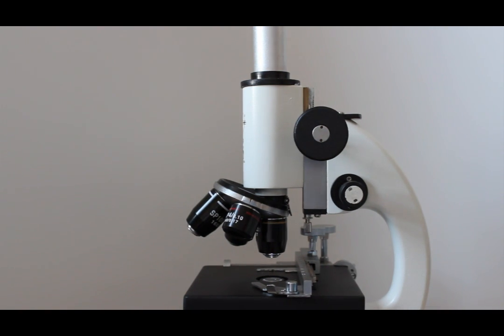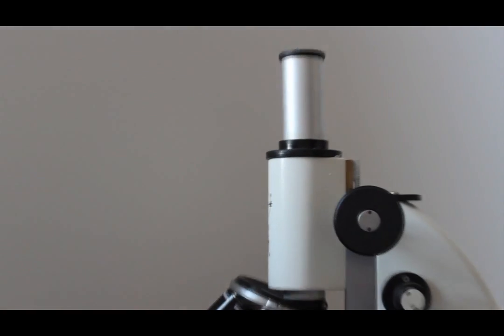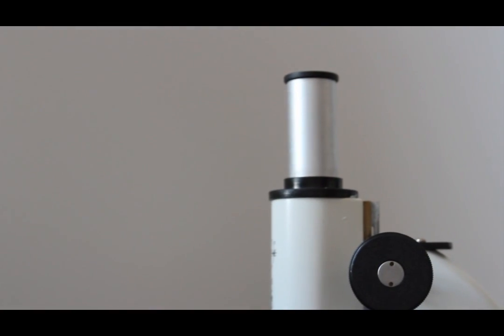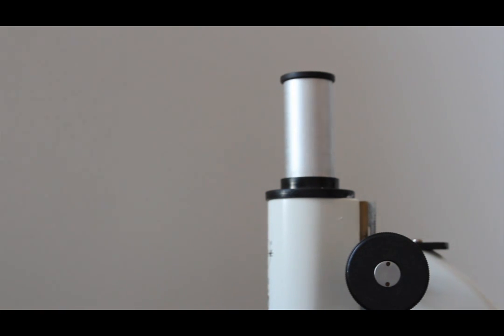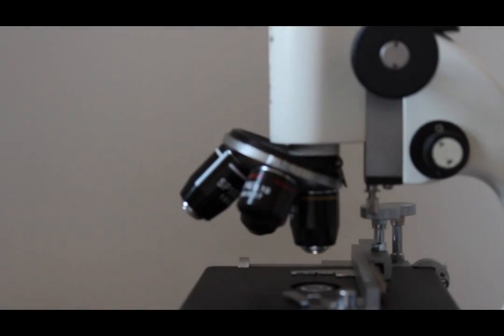All right now that's out of the way. Let's start off by going from the top down. The top is your ocular and that has a certain magnification which in this case is 10 times. And you have to get total power of your microscope, total magnification I should say, you could multiply your ocular by your objectives.